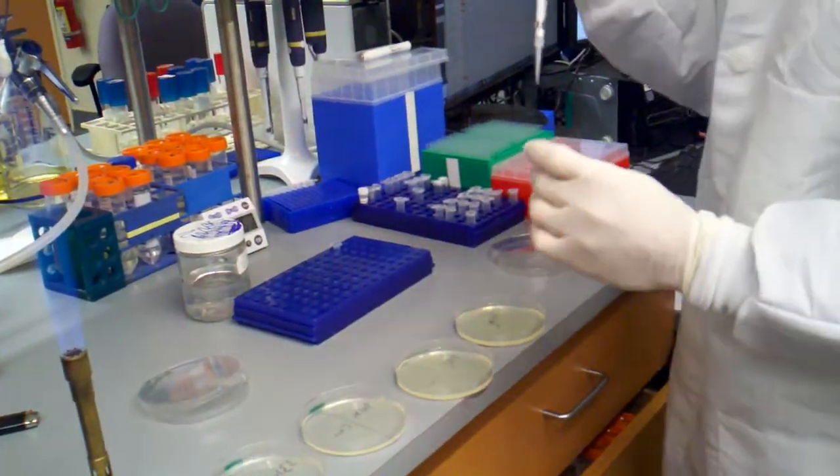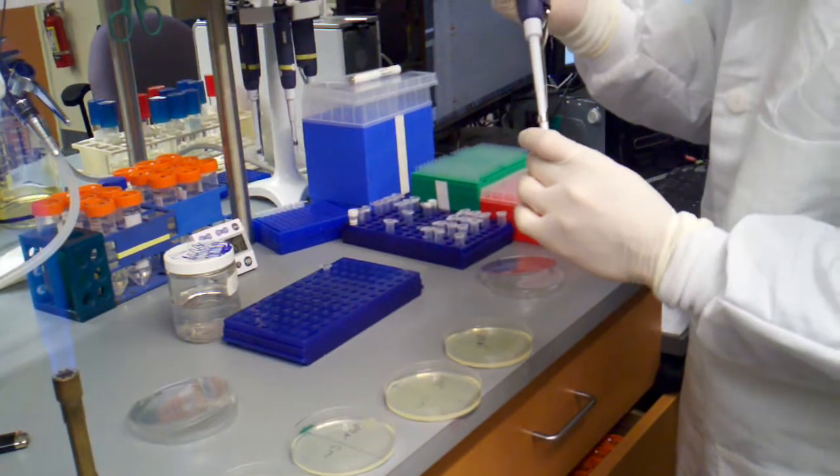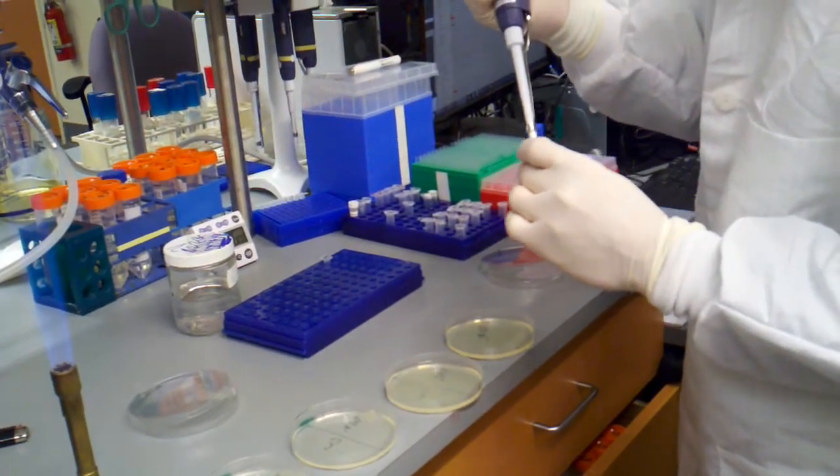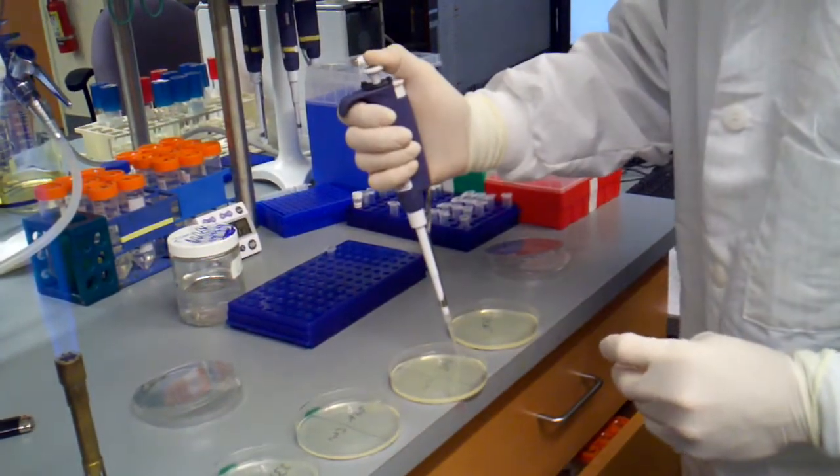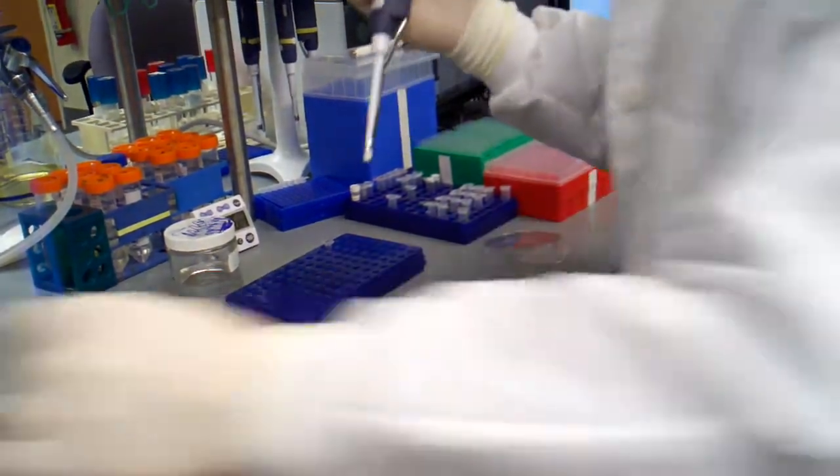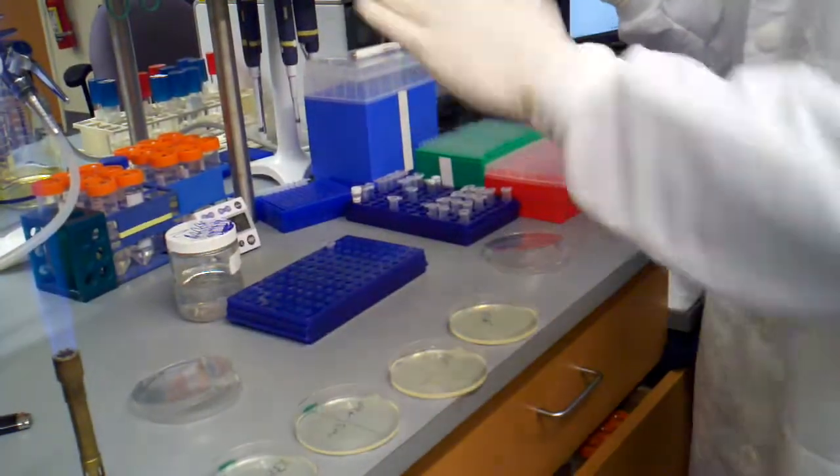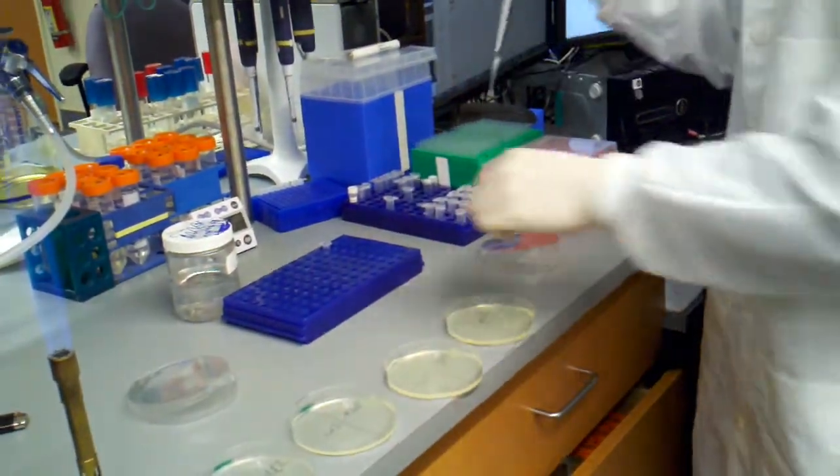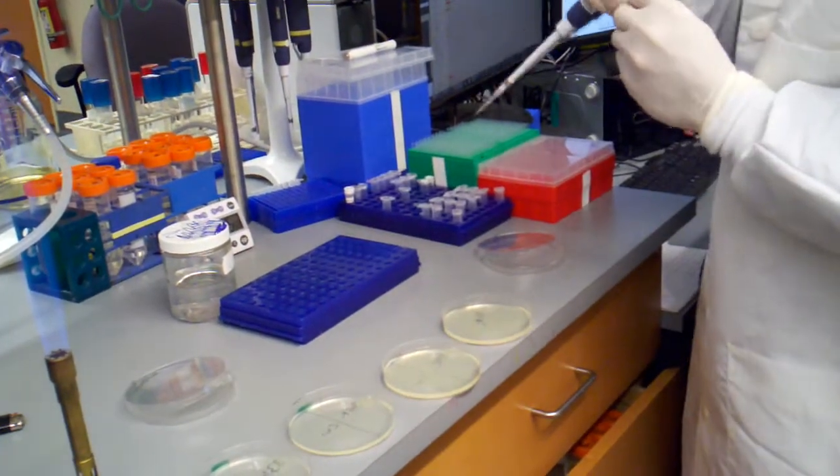Now we're going on the chloramphenicol, 34C. And I have these all pre-labeled so you don't get all confused. You just gotta remember that it's upside down, so if you label the tops and you flip it upside down, you can see that it's upside down, 35C.